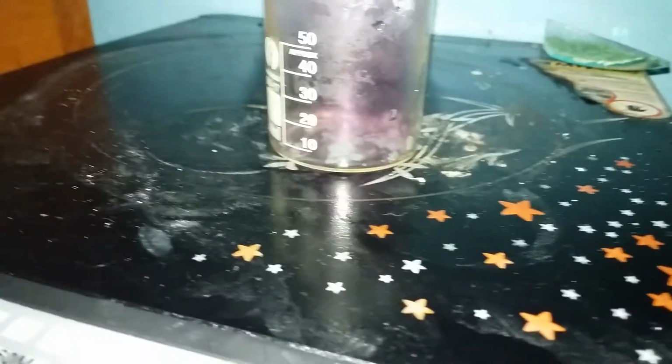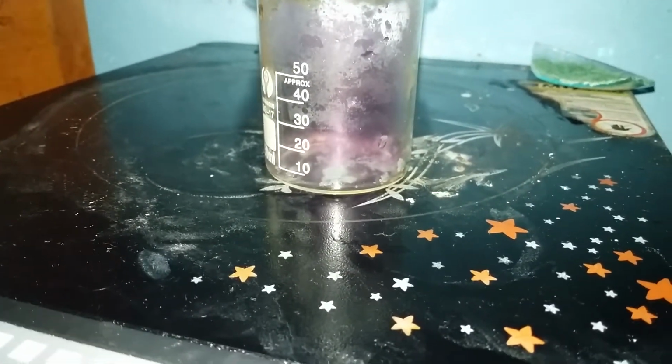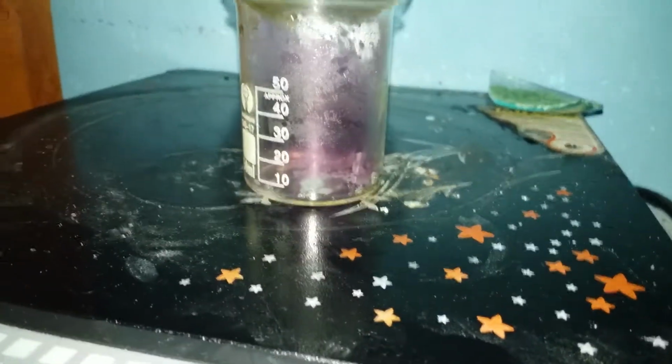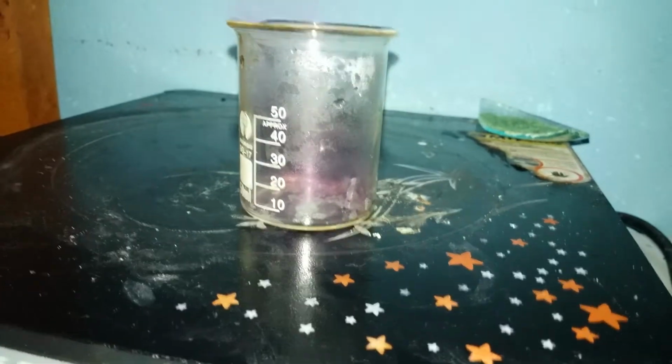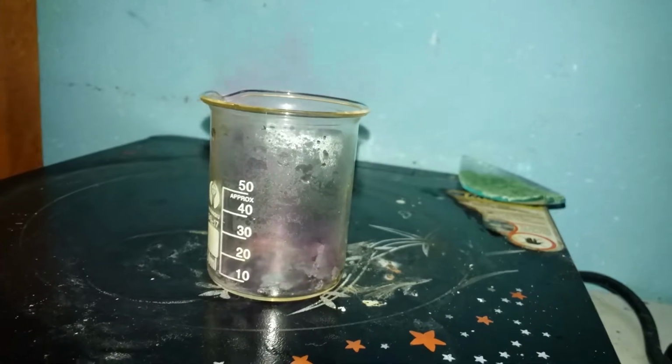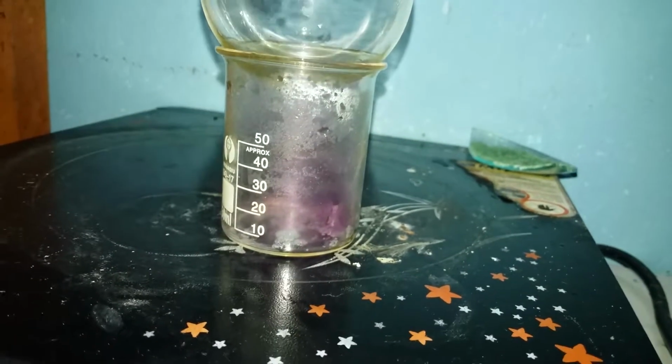Now as you can see, it's starting to vaporize, and I'm gonna check in when it's okay. First we're gonna let the vapors out. As you can see, purple, really nice purple vapors. Okay, put it back on. And yeah, don't touch iodine directly, as it stains everything. Oh my god. Okay, so we're still transferring the iodine.